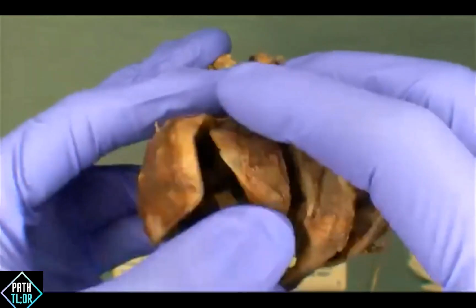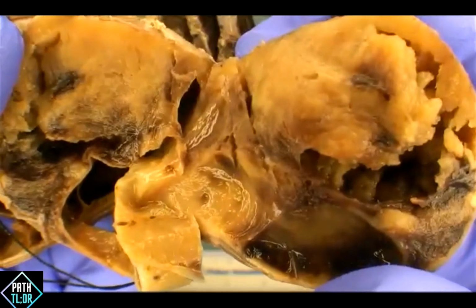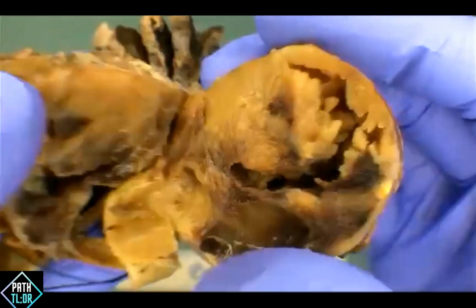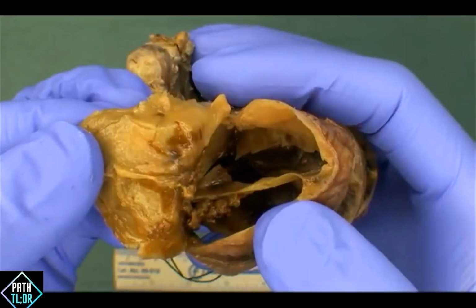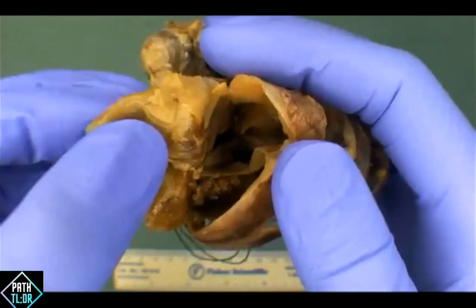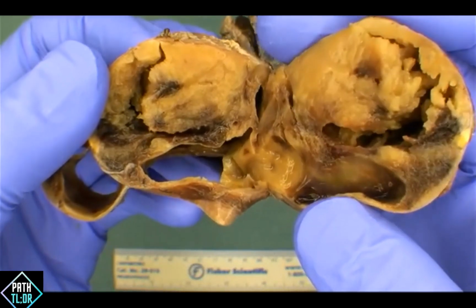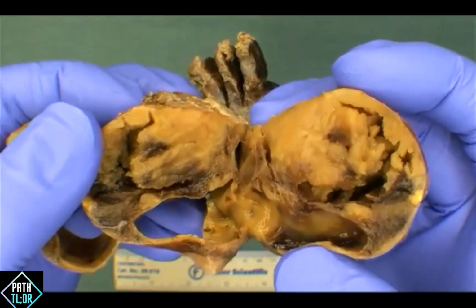Thoughts in terms of the differential for this nodule? What do you think? What could this be? Okay, maybe papillary. I'm assuming papillary thyroid CA. Other thoughts on what this lesion could be? Maybe everybody's also favoring papillary. Any votes for benign? That's a good one. Cystic degeneration and multinodular goiter. Good. Okay, so what's really interesting is this particular case was submitted to us as multinodular goiter.